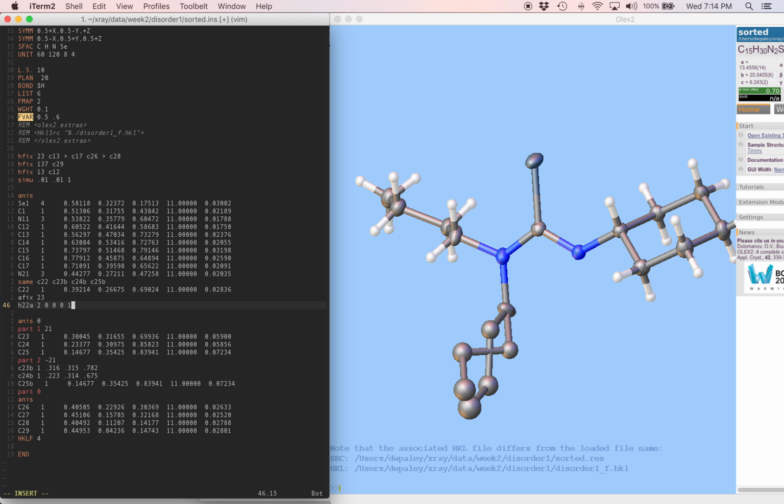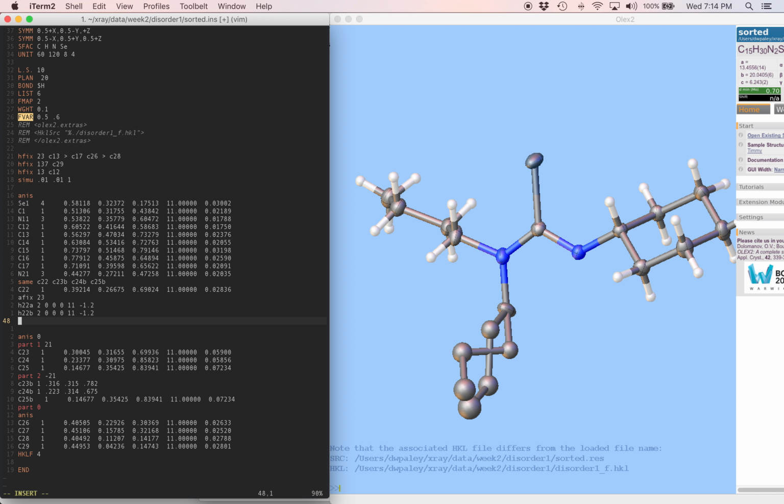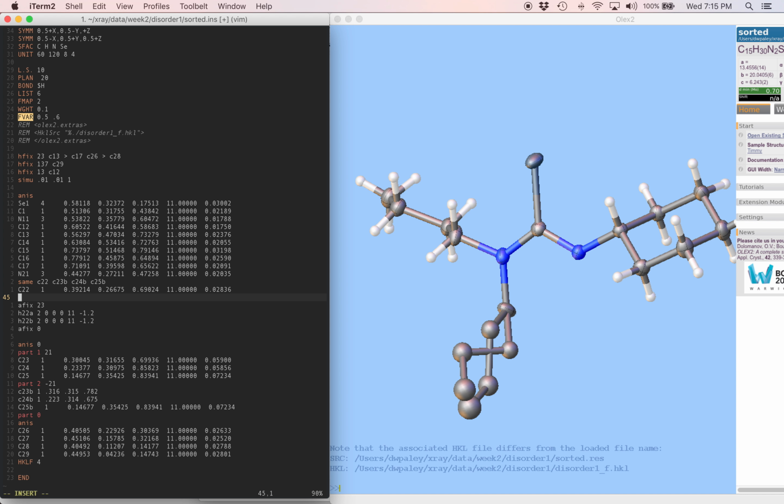displacement parameter does matter because we need to tell this hydrogen ADP to ride on the carbon ADP. So the code for that is minus 1.2, and that tells us it's going to be 1.2 times the carbon equivalent isotropic ADP. I'm going to make a second hydrogen, same as the first one, but a different name. And after that, I put an AFIX 0. Oh, I forgot the whole thing we were doing here. These first two hydrogens are in part 1, and they're going to have the same occupancy as the rest of the first disordered chain, which is 21.